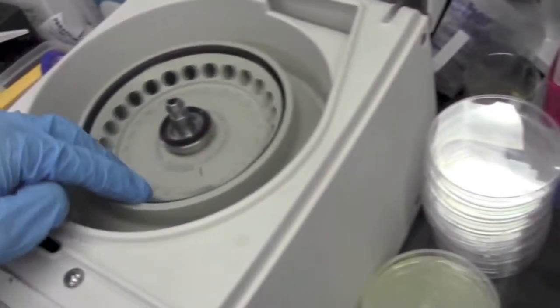So here I am placing the tubes into the tabletop centrifuge and I'm balancing that.